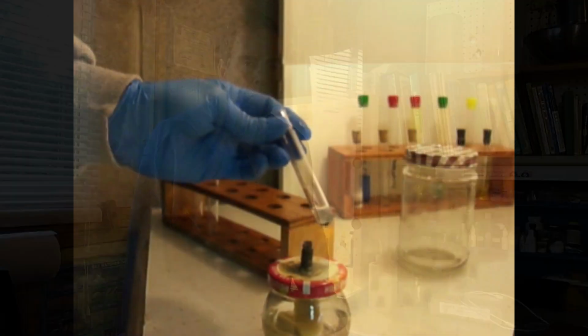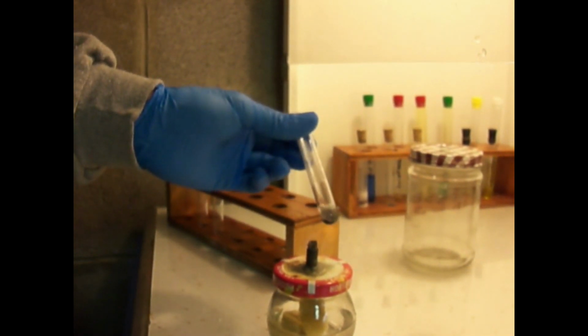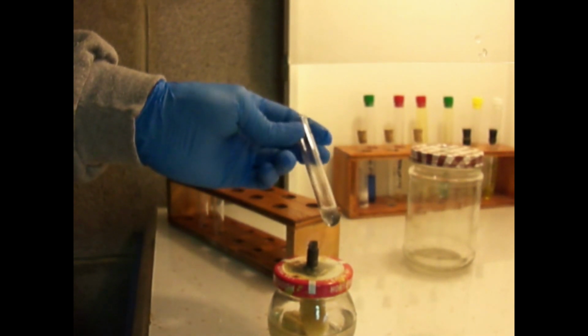The next thing we need to do is dissolve the material in acid. Galena is soluble in hydrochloric, but I don't think pyrite or chalcopyrite is, but they should all be soluble in nitric acid. Definitely continues to give off gas upon heating in the acid.